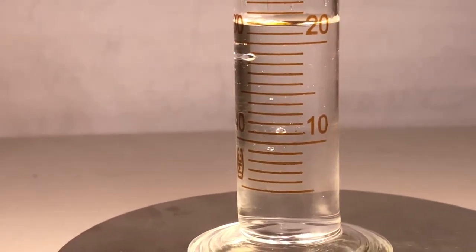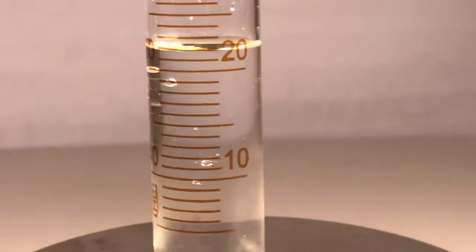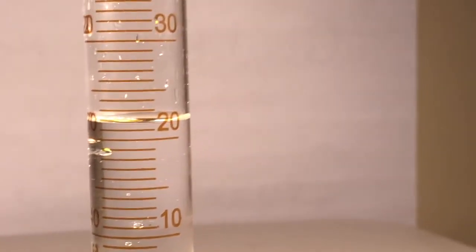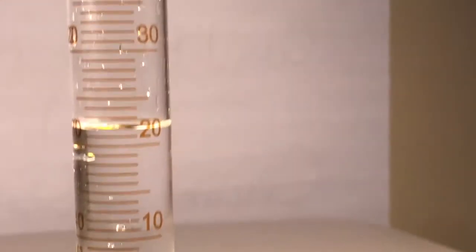This time we're just gonna do 1 in there. Just mix it up a little bit. What you got, what you got, what you got? Bird's eye view says, you count. You see what that is? And now the mass.